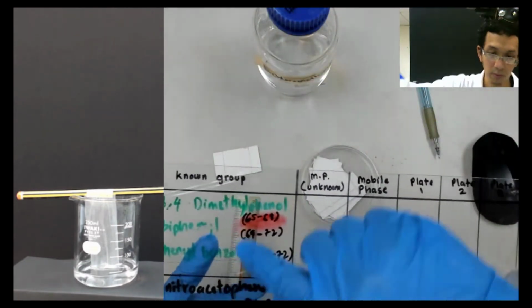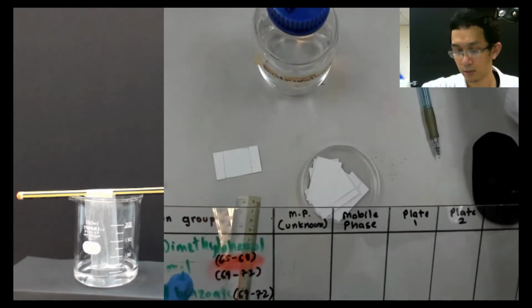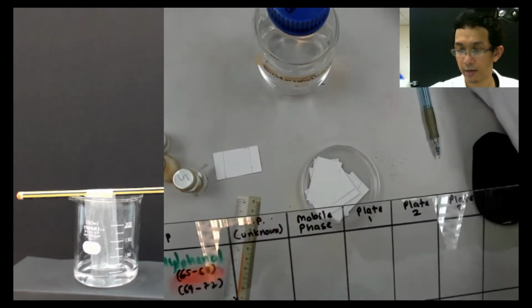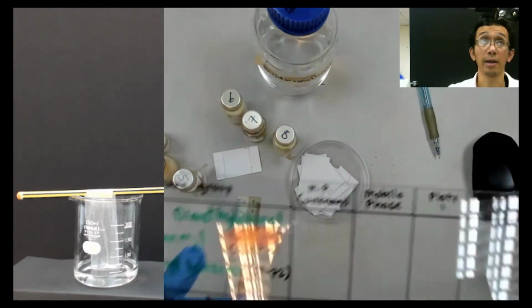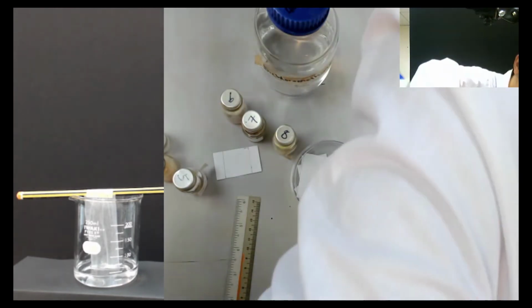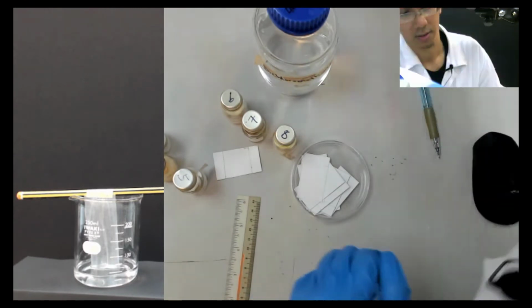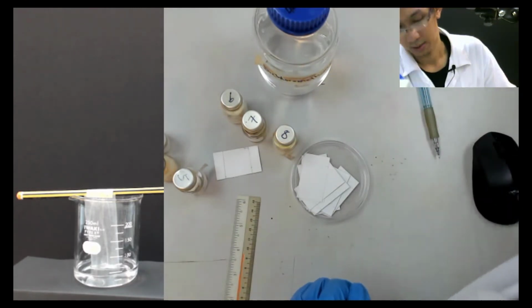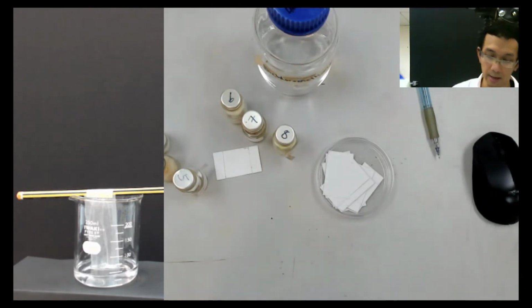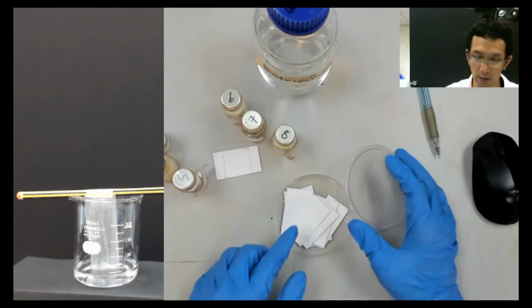So group 2 is 4, 5, 6, 4, 5, 6. So I just put it here so that I do not make a mistake. 7, 8, 9. So here, and then this is the known sample. So this I will put over there so that I'm not messing it around later on. Okay. So you have this thing, and now we will mark first. How do we do it? So let's do it for group 1, 2, 3.